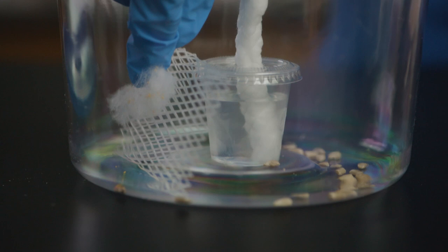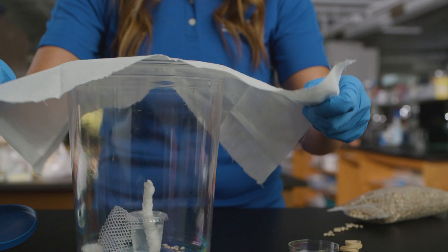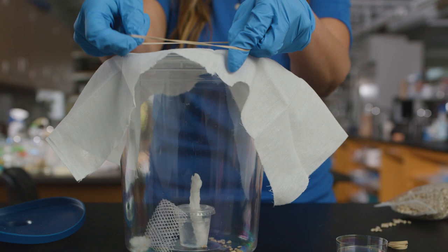Newly hatched milkweed nymphs are very tiny, so cover tightly with a cloth or plastic with tiny perforations to allow for air exchange. Securely fasten the cloth in place with a rubber band or tie.